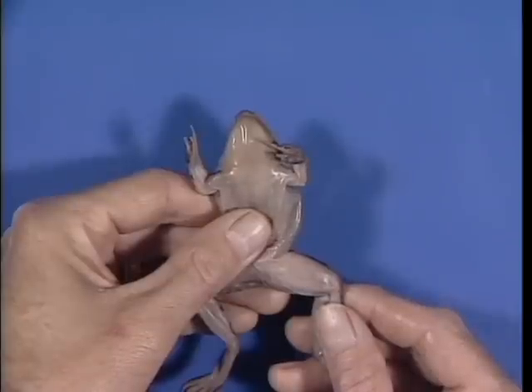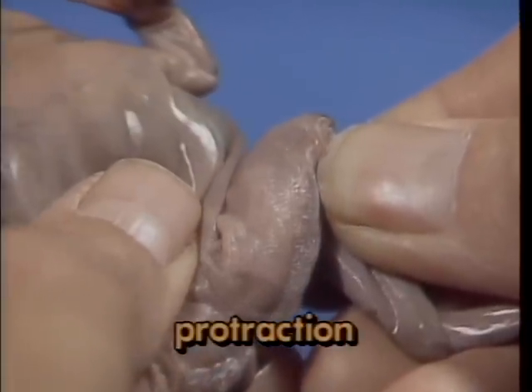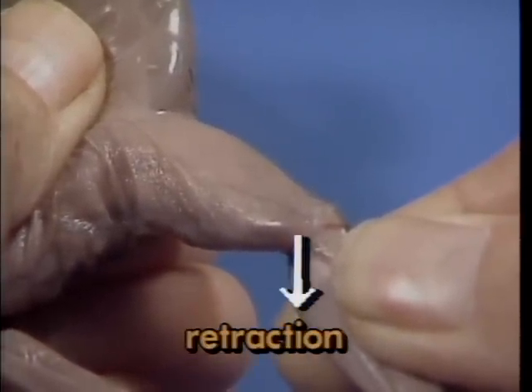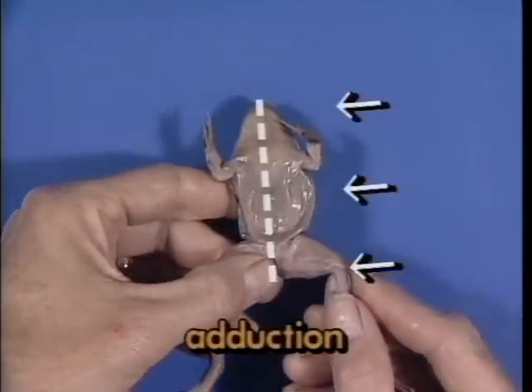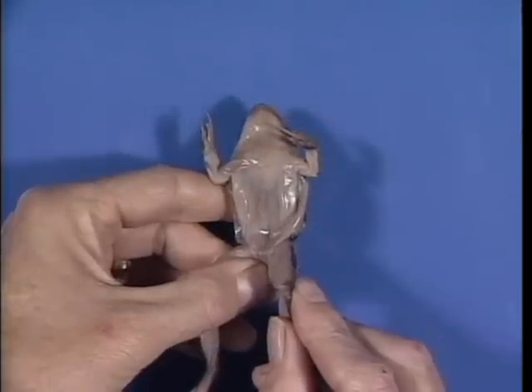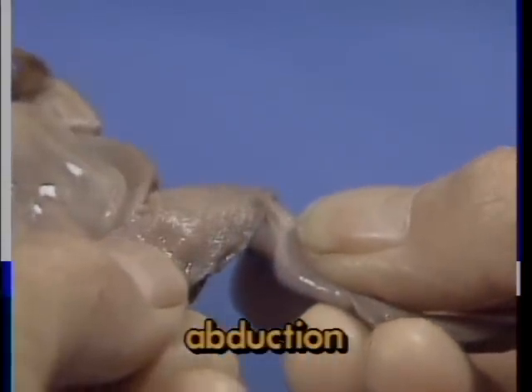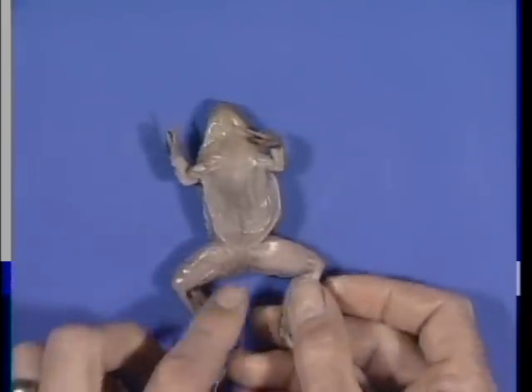If the leg is moved toward the anterior portion of the body, it is undergoing protraction. Pulling the leg in a posterior direction is considered the opposite of protraction and is known as retraction. Limbs can also be pulled in toward the midventral body line, which is called adduction. Likewise, using muscles which act antagonistically to these would move the limb out away from the midline, a process called abduction. Now let's move to a consideration of how we should go about examining the muscles of the frog.